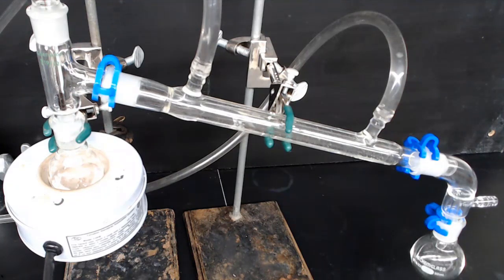Once you've collected the material that boils in the desired range, you might notice a couple of things. The temperature on the thermometer might drop. That would be because there's no more vapor keeping the thermometer bulb hot, which would indicate that your material is done distilling.